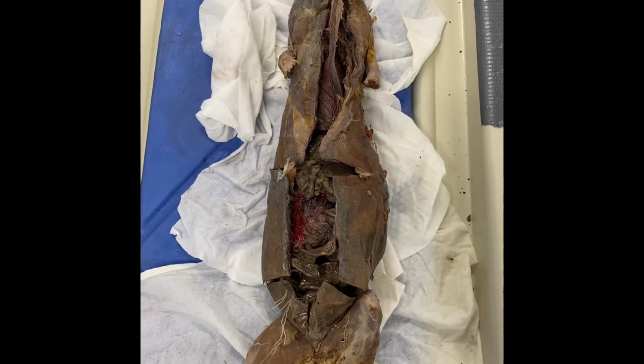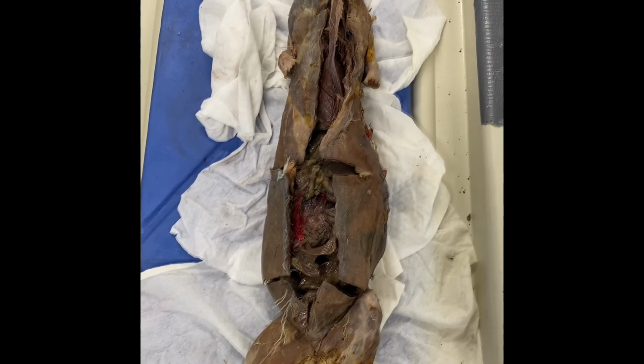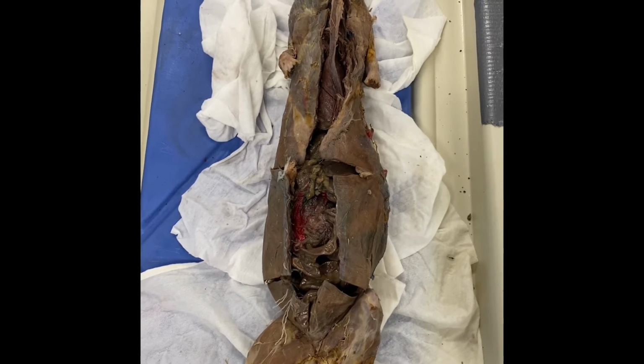the biceps femoris in the mink is much larger. Peristalsis is an involuntary movement of the canals of internal organs that helps push the contents in the canal forward. The omentum is a large layer of adipose tissue that goes over the stomach. The omentum stores fat and regulates the immune system.